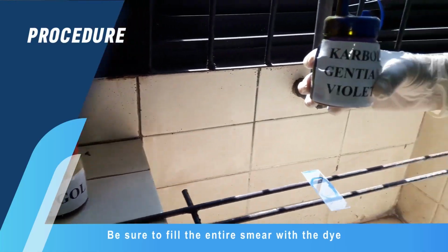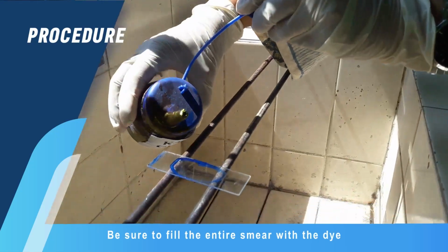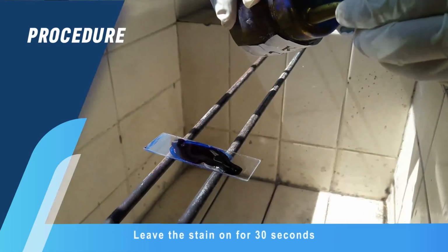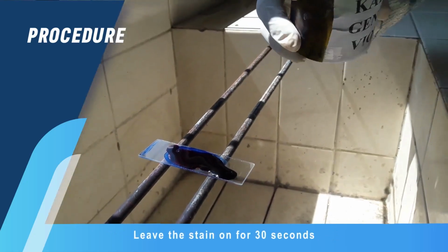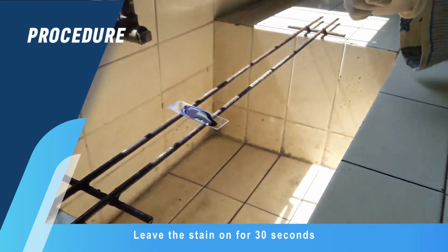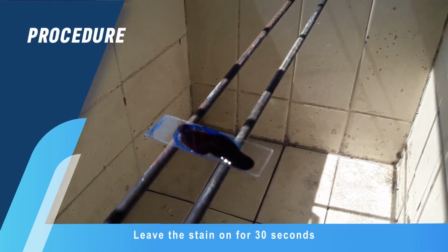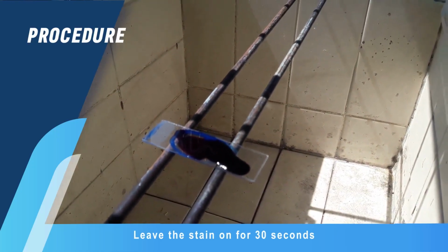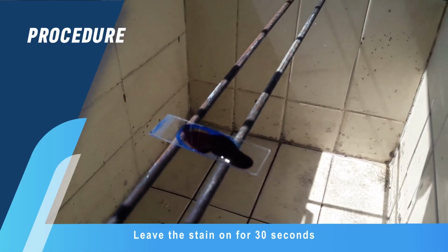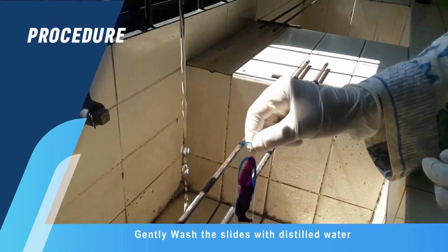Be sure to fill the entire smear with the dye. Leave the stain on for 30 seconds. Gently wash the slides with distilled water.